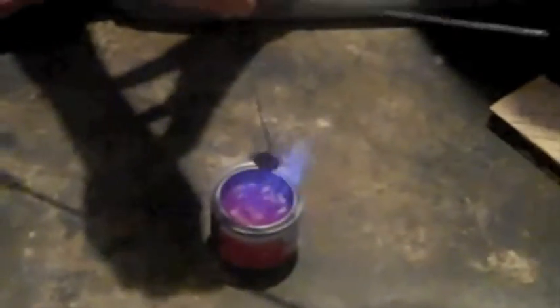Okay, first we will put this copper penny in the fire until it's red hot, which means it's exothermic, meaning it's producing heat. Now that the penny is red hot, we are going to dangle it in a jar above acetone, and we're going to turn the lights off and see if it glows. It's glowing! Oh my god, it's working!